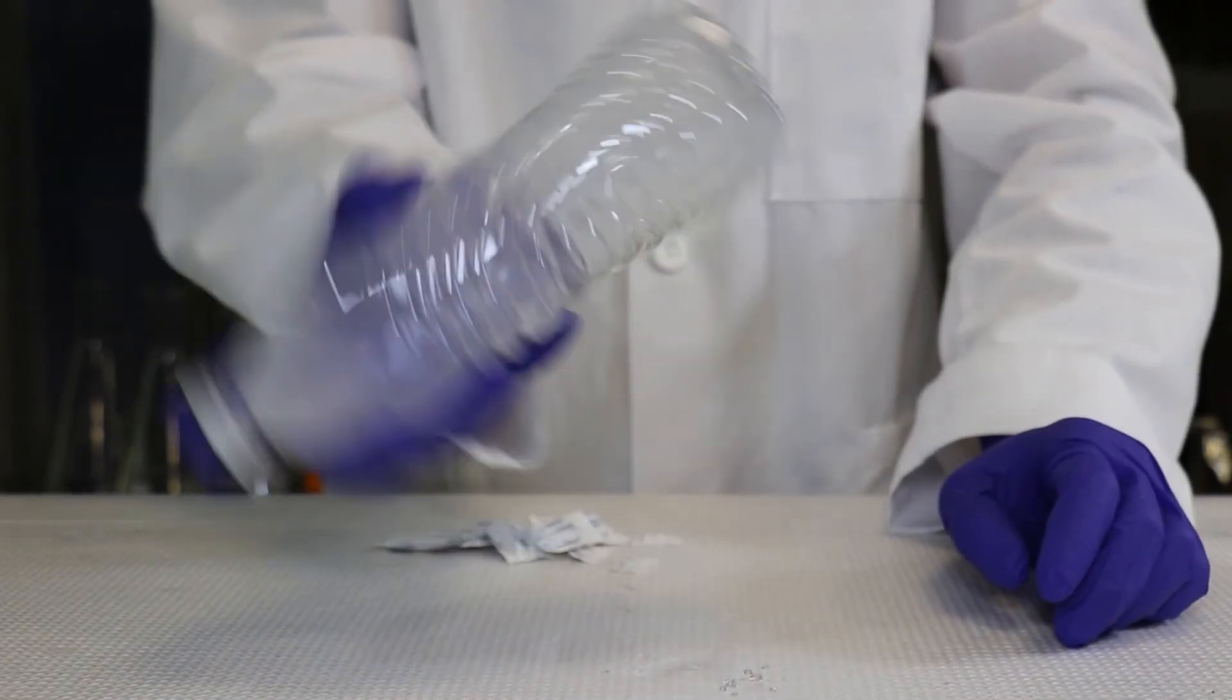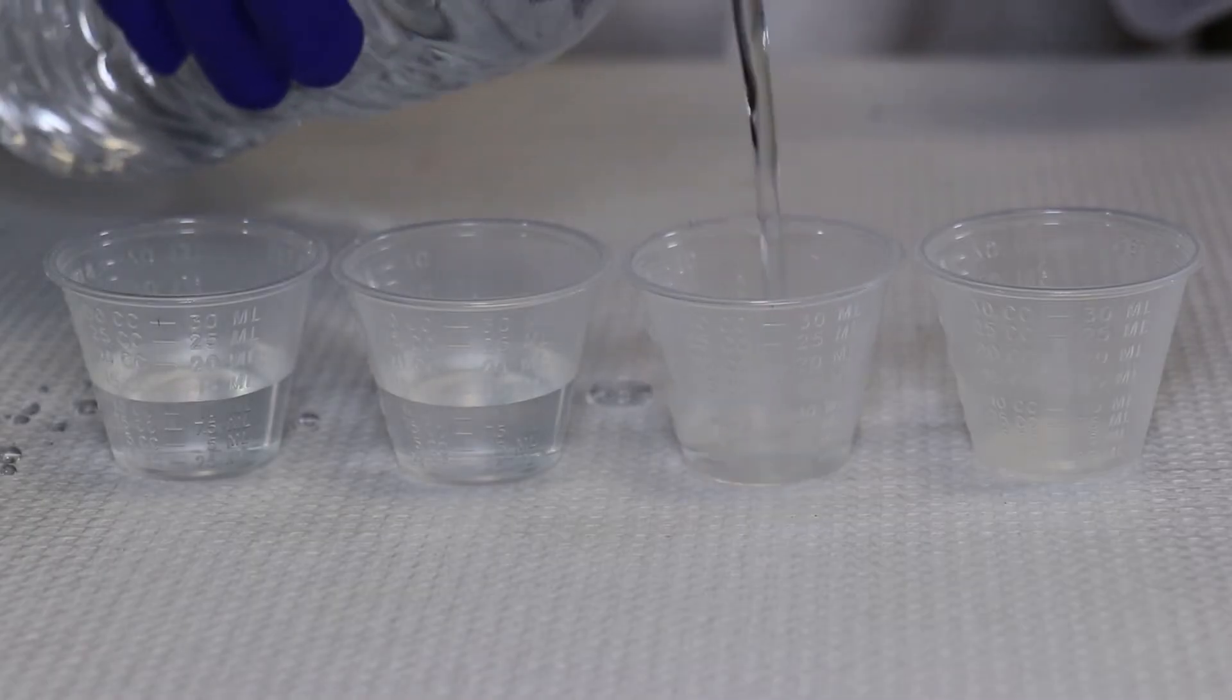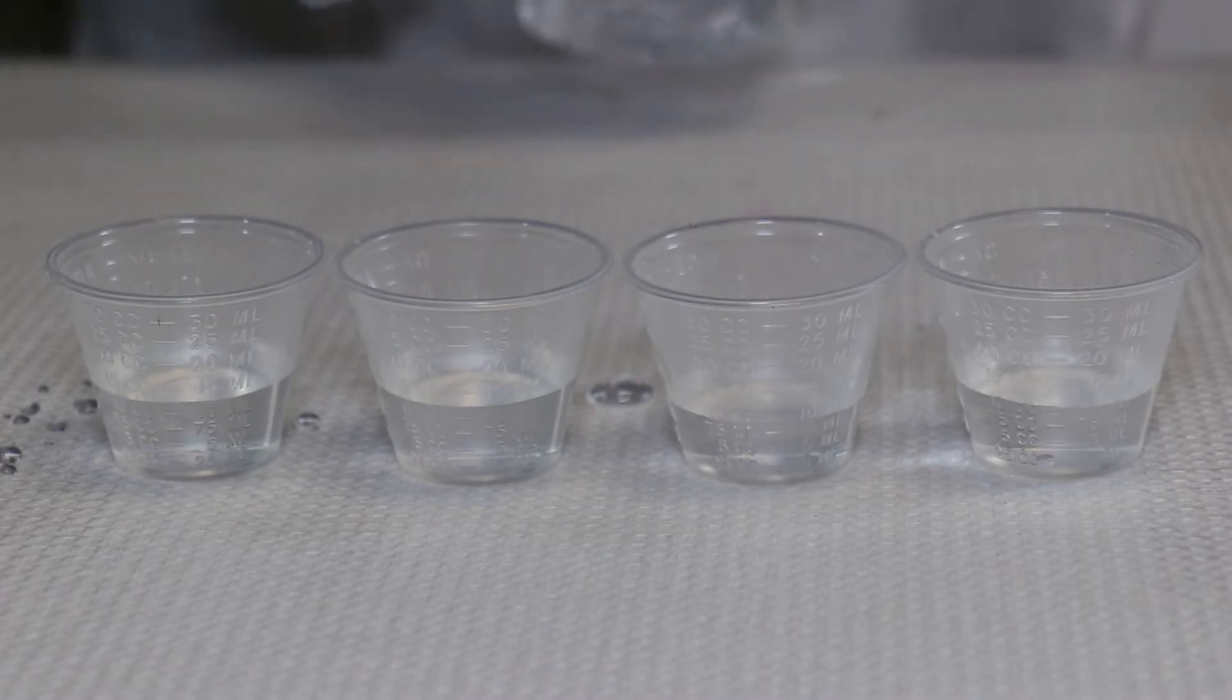Distribute 1 cup per student. Preparation of the lysis buffer: Step 1: add 100 microliters of Component A universal DNA buffer to the tube of proteinase K.